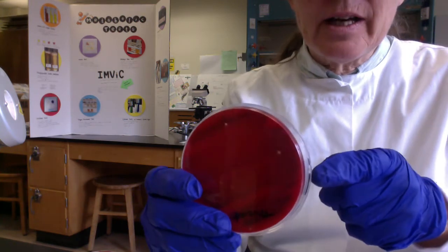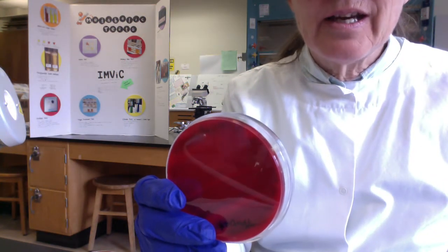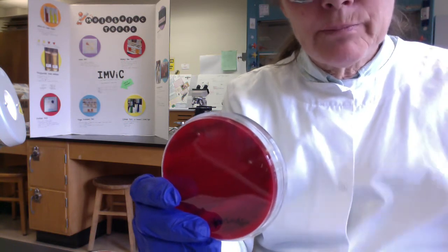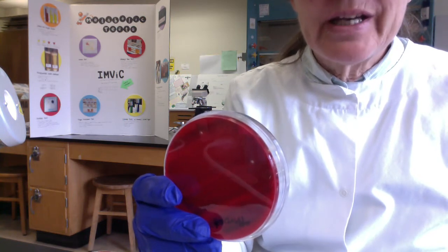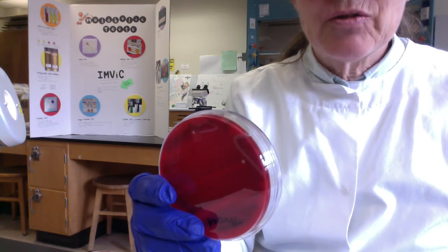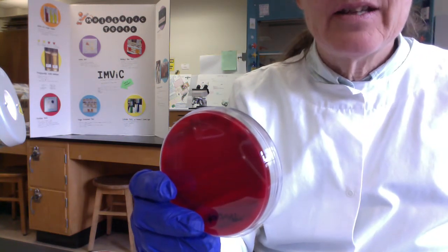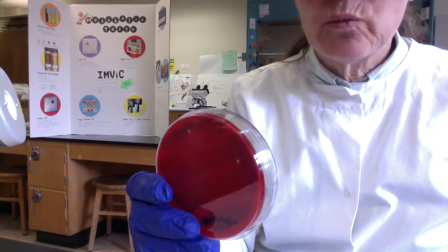Now, these two little dots that we see here, you might think, oh, that's beta hemolysis, but that's an artifact. I took my swab and I pushed it through the agar. So that's literally light showing through. But indeed, you guys, if we had beta hemolytic Streptococcus pyogenes or Staph aureus, it actually would look just like that. The beta hemolysis is total destruction of the red blood cells. You can read right through it.